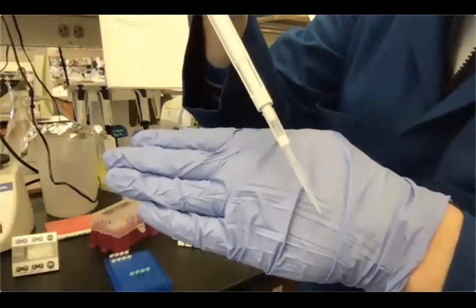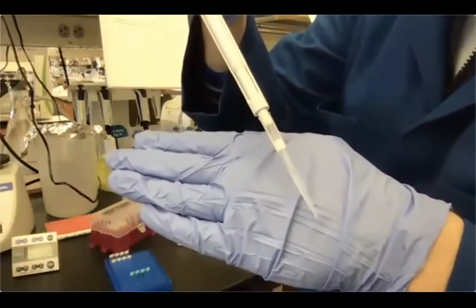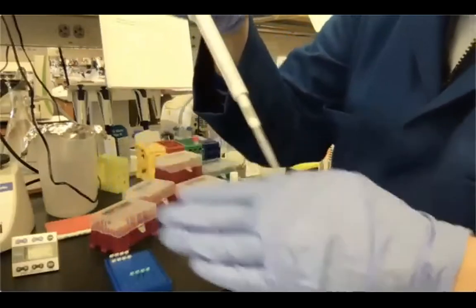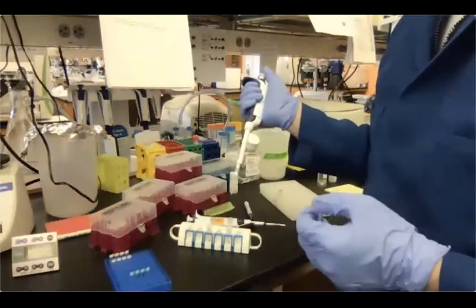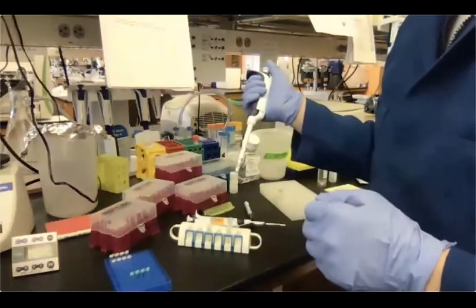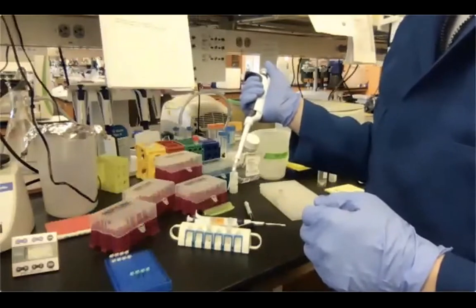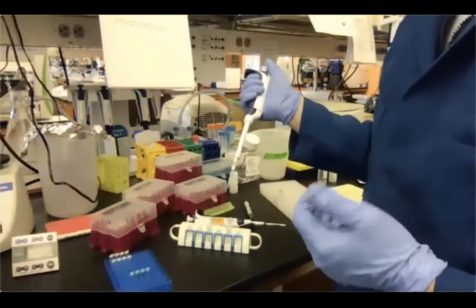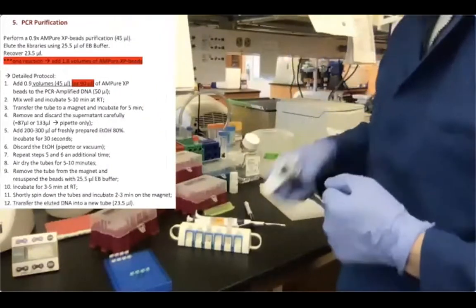That will signify that I have some beads that I'm gonna discard. If this happens, you can just put the supernatant back in your tube and wait a few minutes for the separation. And then maybe instead of removing, like in this case, 133, you remove 125 or something like that, okay? So I'm just gonna discard my tip with my supernatant.